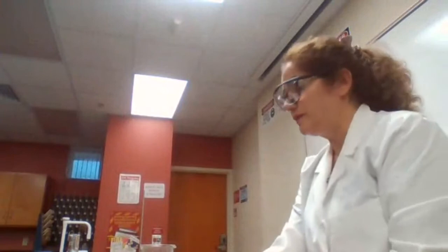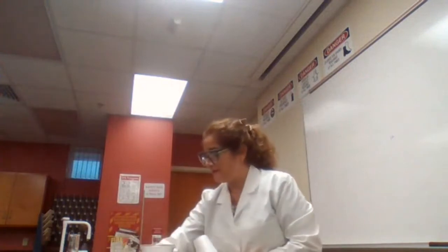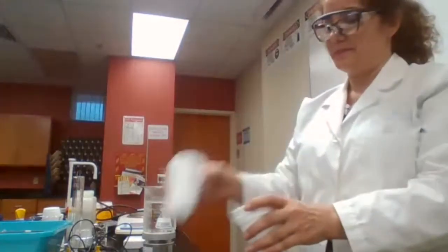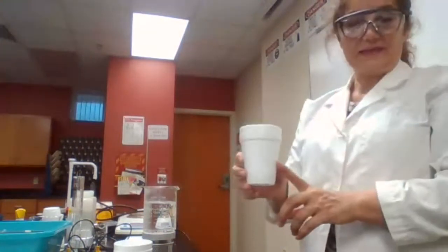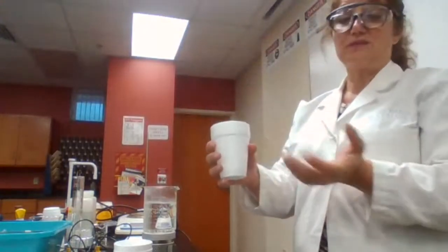Okay. Now, experimentally, how we are going to perform this experiment, and what we are going to use, we are going to use a calorimeter today. The calorimeter that we are using is not a perfect and fancy calorimeter. We are going to build our own calorimeter here. We are going to use a coffee cup. And why coffee cup? Because coffee cup is a good insulator of the heat. That's why you drink your hot beverages in a coffee or styrofoam cup, because it doesn't transfer the heat easily.